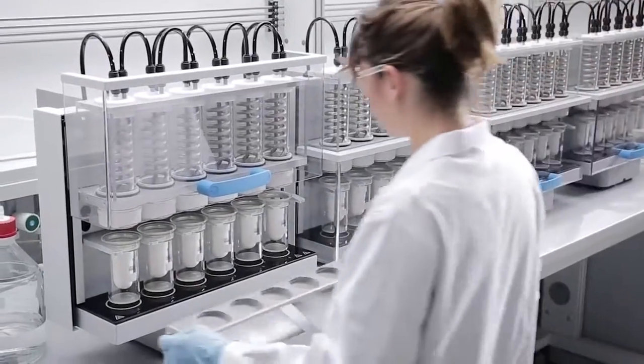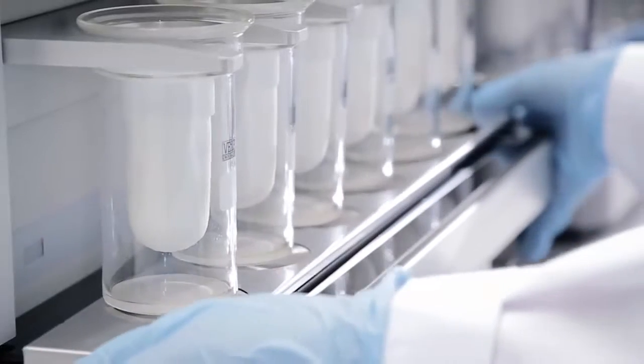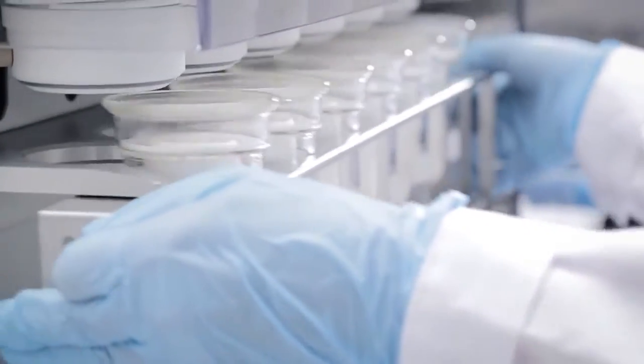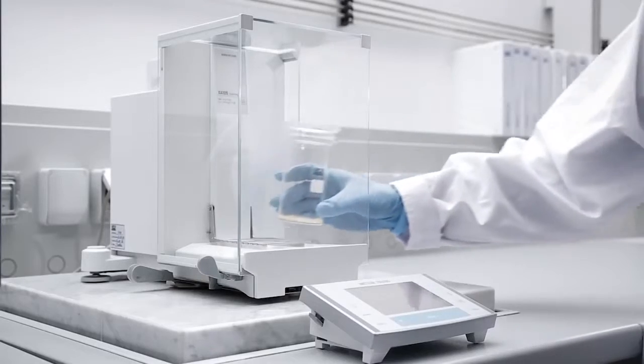The extraction cups containing the extract can now be placed in a drying oven, cooled in a desiccator and weighed.